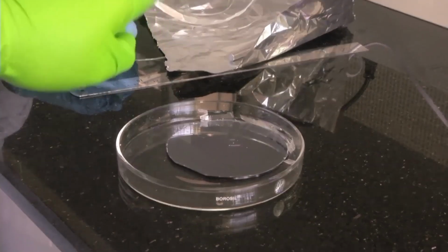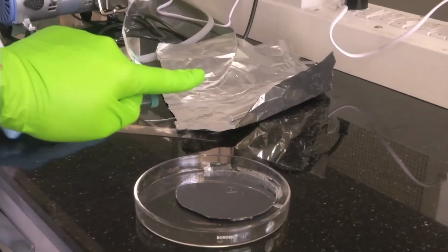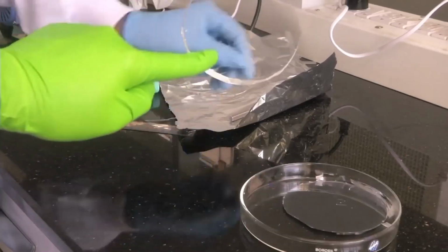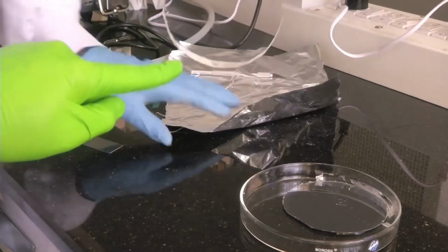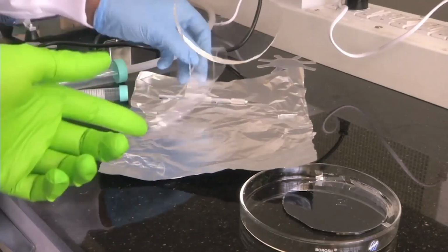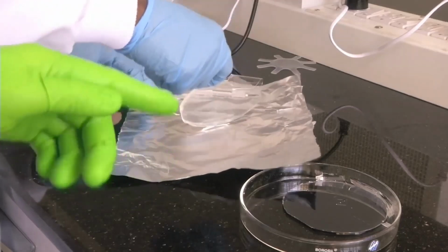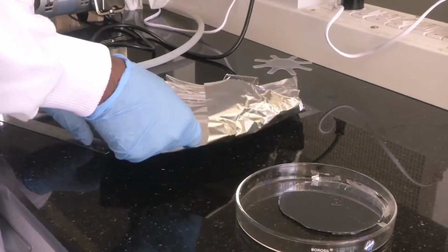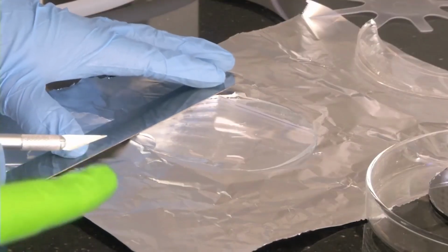Because now this membrane is circular, but we need to make a rectangular shape out of this membrane. So that is the next final task. And then once that is done, we can store this device. Now this is also a device. This PDMS membrane is a device which we can stick onto an electrode or a glass slide. So we have to cut it out to a required shape and store it in aluminum foil or any other storing material. So now we are cutting the channels into a rectangular shape.